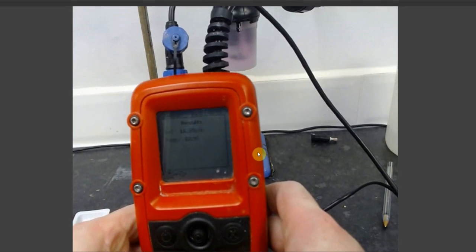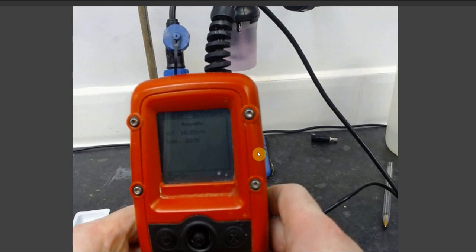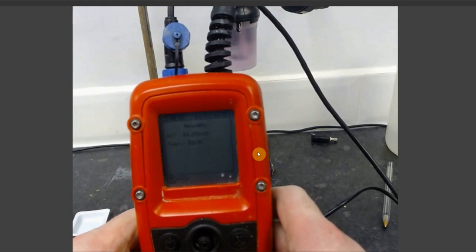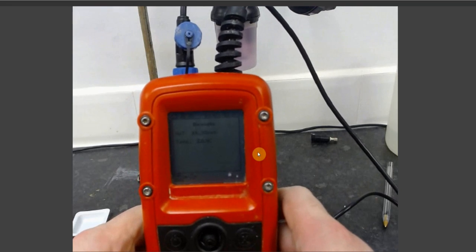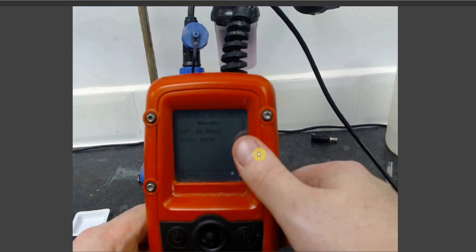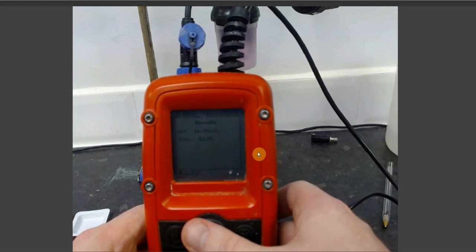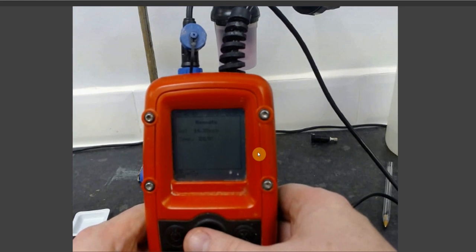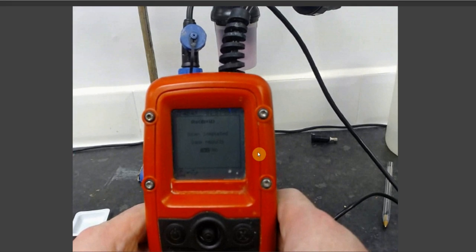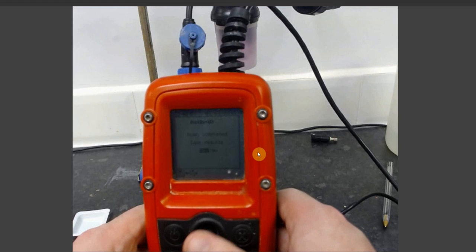Once your Metalyser has finished the second voltammogram, it will calculate the concentration of your initial sample as a function of parts per billion and will also display a temperature reading at which the analysis was done. If you press select, the Metalyser will take you to a prompt as to whether you wish to save your results or not.